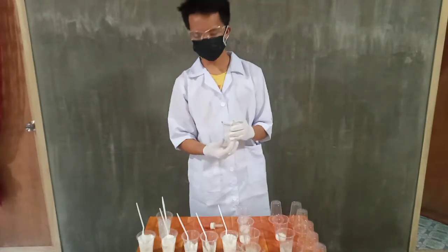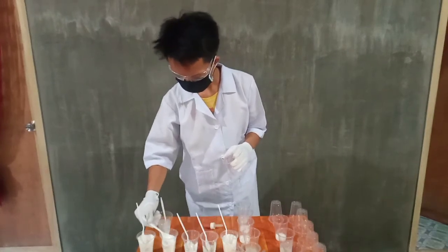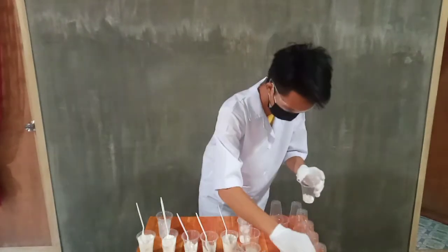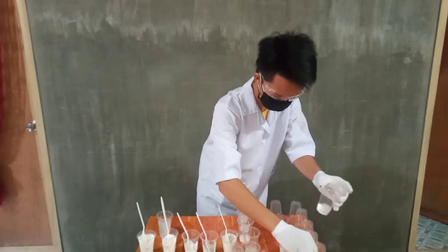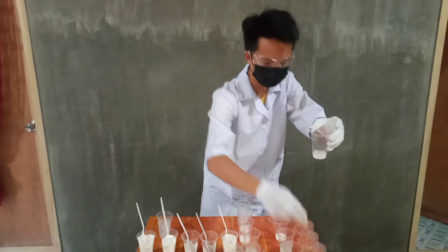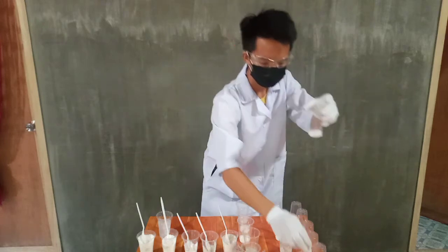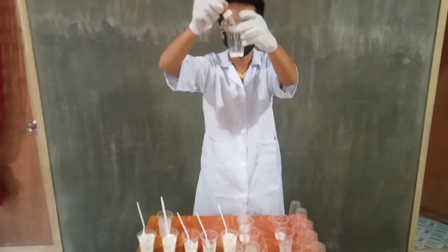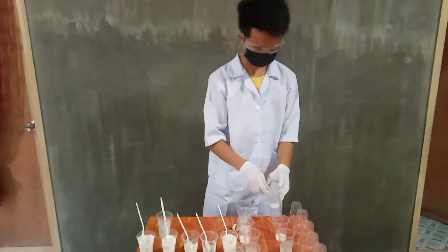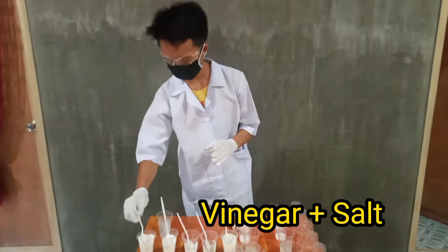And now let's try the mixture of baking soda and the vinegar. Wow, there's a reaction. Baking soda and the vinegar produce a bubble reaction. Look at this. The next one is the mixture of salt and vinegar.